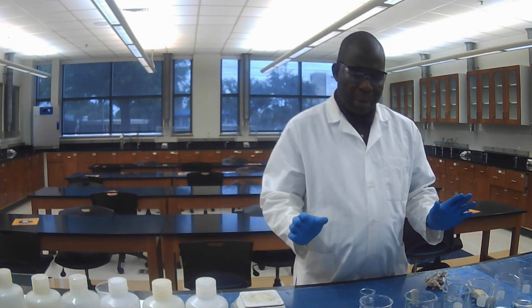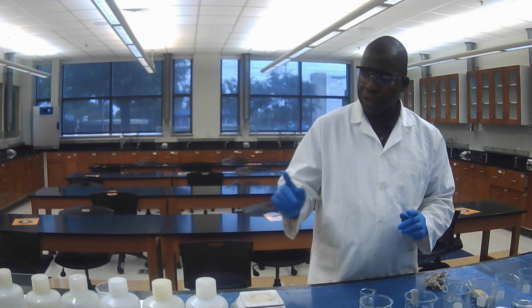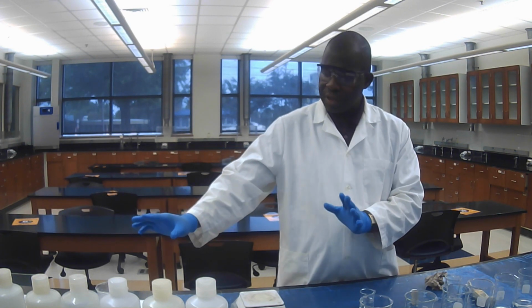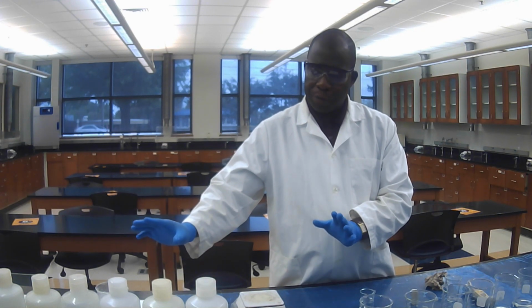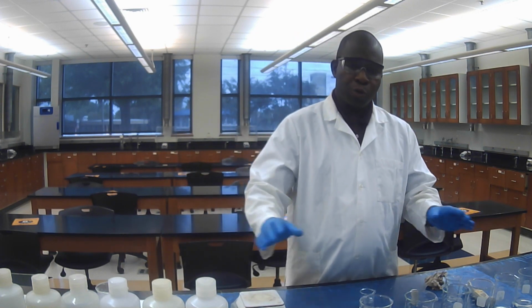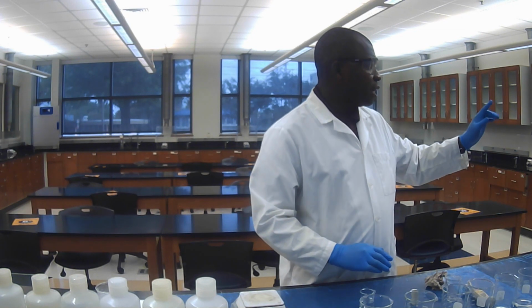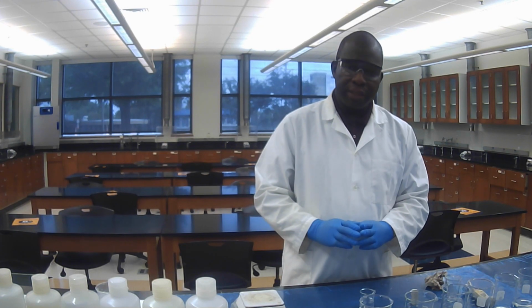So this is part 1 of my experiment. Do not forget, you also have to take the pH of the boiled water. We are waiting; when it cools down, we will do that. Then after you take the pH of the boiled water, you have to clean up, rinse all the beakers, and dispose of all the solutions you used in this experiment in the liquid waste provided to you in this lab.